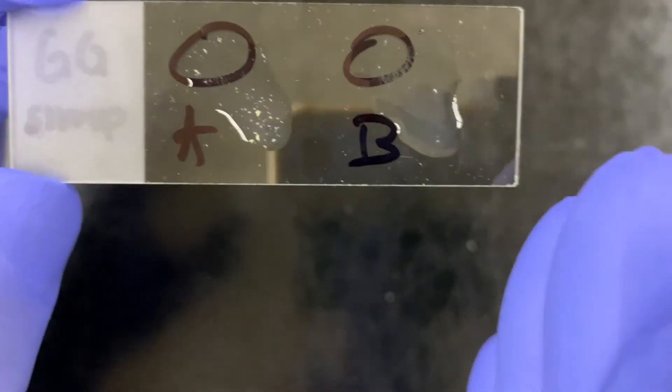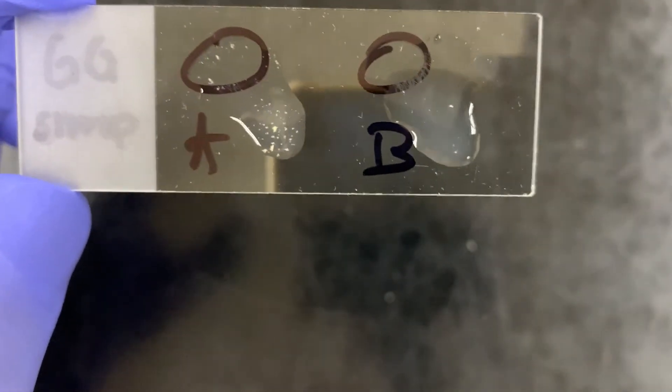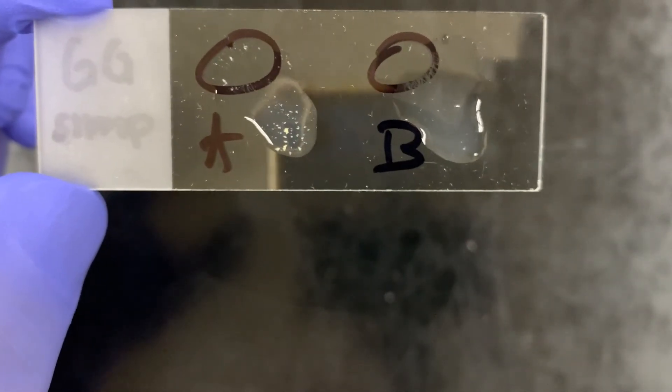So this means that, using our presumptive test, bacterium A is coagulase positive and bacterium B is coagulase negative. We have therefore presumptively identified bacterium A as Staphylococcus aureus and bacterium B as some other Staphylococcus, since we know both are gram-positive cocci and both are catalase positive.